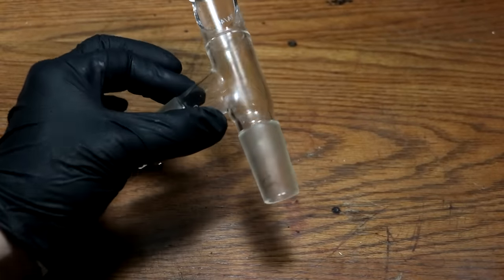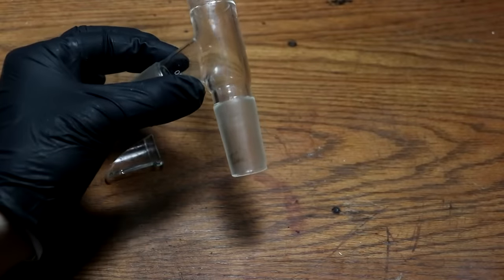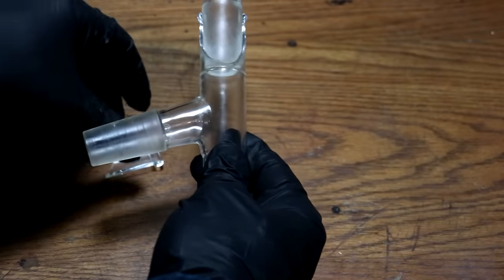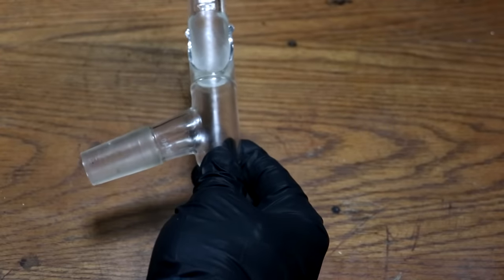So in the video, dissolving gold using cherry pits, I broke a piece of glassware. It's this distillation adapter here. After I had added acid into the flask, I went to cap it off, and this piece of glass broke off right here. It just snapped it.